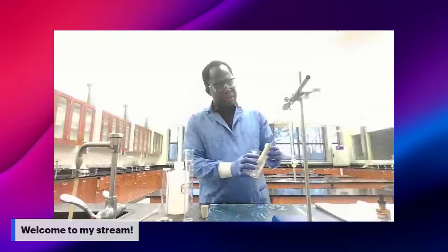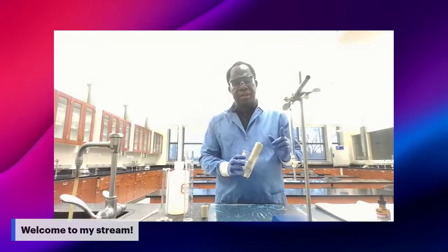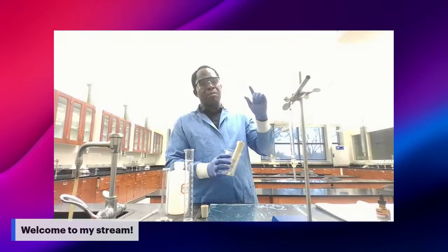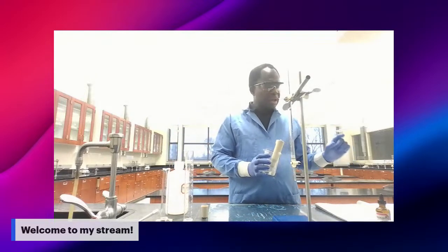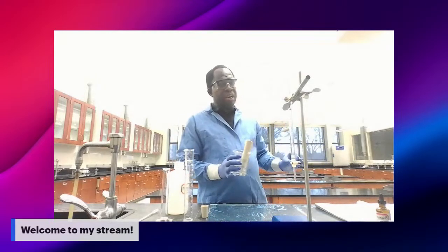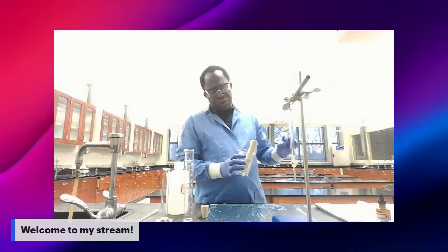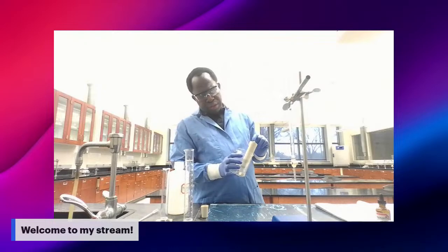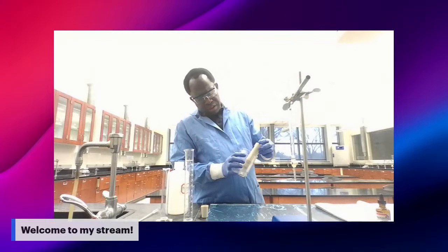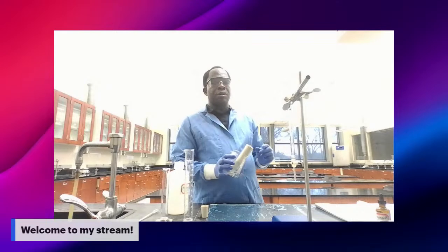This is what you get when you add 1 milliliter of NaOH. So in your book note, you need to write down 1 milliliter, and the pH corresponding to that 1 milliliter of NaOH should be 3.4.